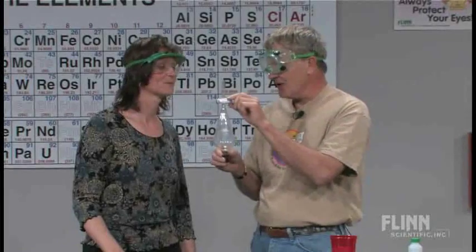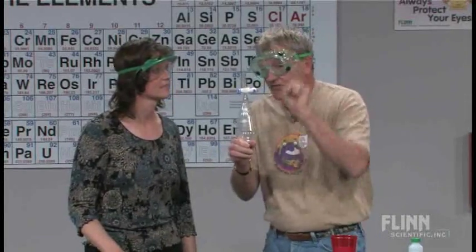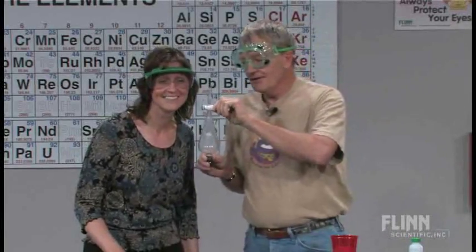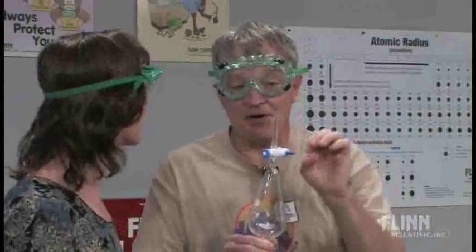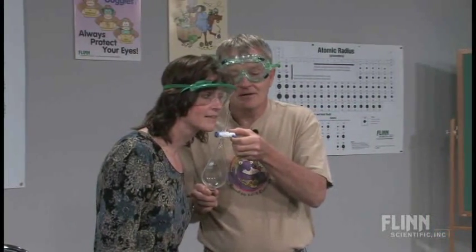Okay, so we're listening now, okay? We're listening. And it's conceivable maybe it's lower pressure, so I want to make that distinction. Okay, so listen carefully. What's that? Yeah, so the pressure on the inside was higher. Higher, all right, so now I want to swirl this around inside here a little bit. Give it some time. And I'm going to open it again. I want you to listen. Ooh, same sound, right? Okay, so it's still higher.